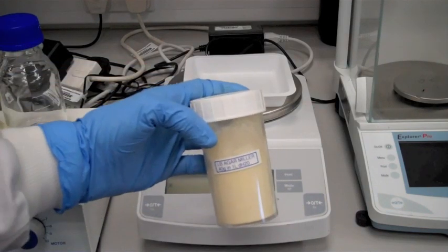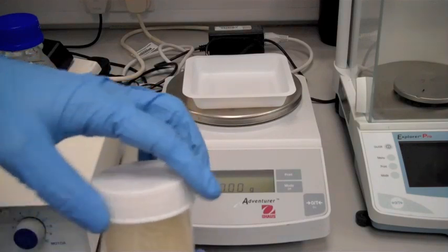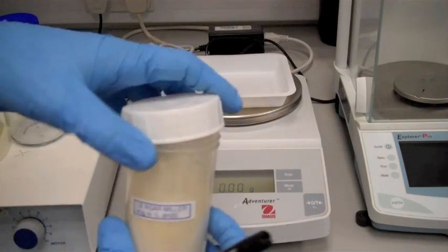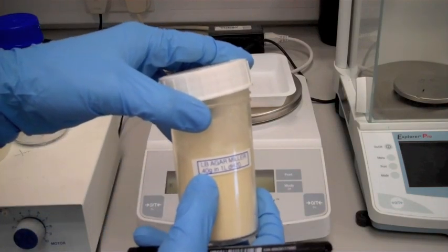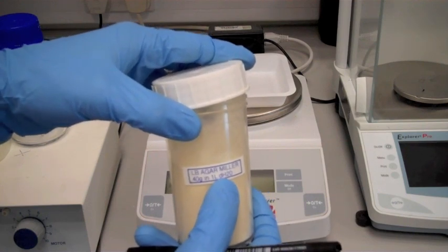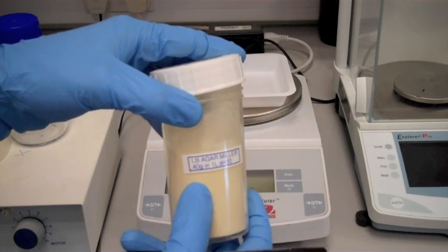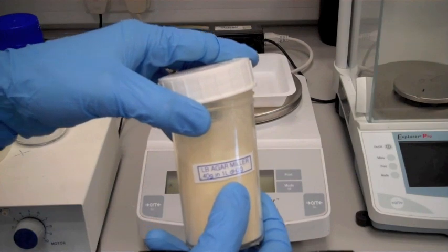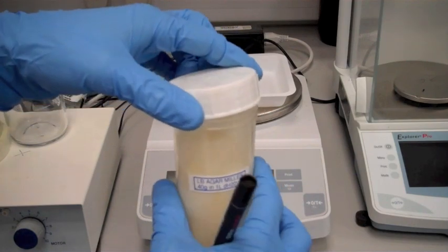Then take your weighing, and since today we're going to be making 200 milliliters, if you require 40 grams in one liter, you require one-fifth. 200 milliliters is one-fifth of one liter, so you require eight grams.